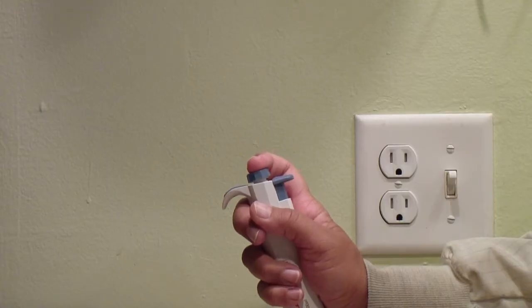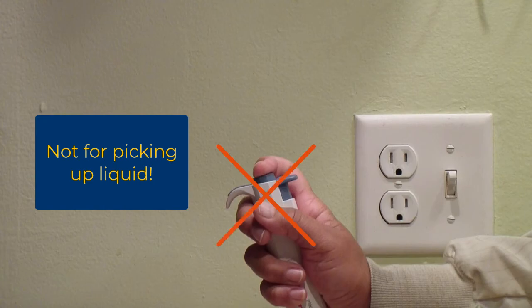Do not push the plunger down to the second stop when you are sucking up the liquid. That would result in too much liquid in the tip and you will not be able to expel it all.